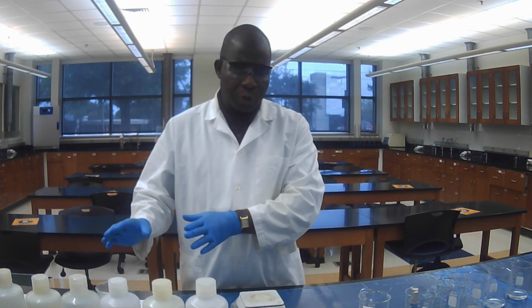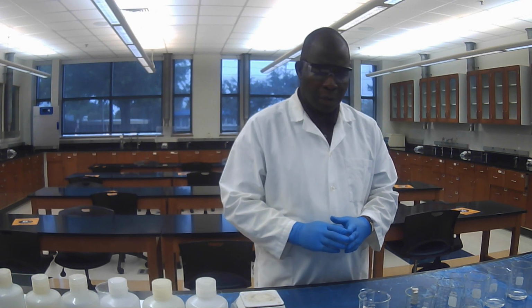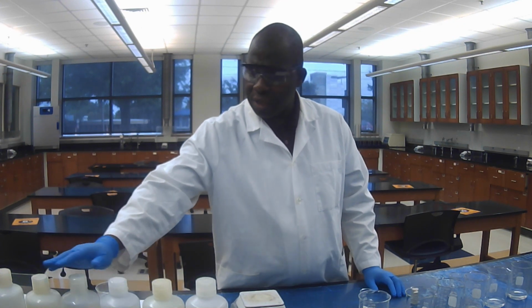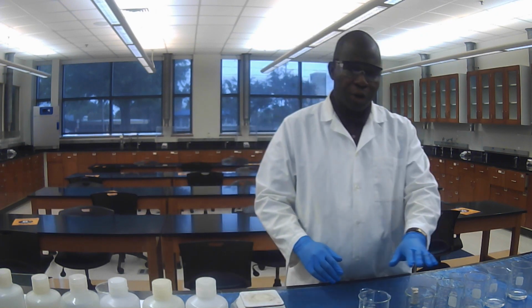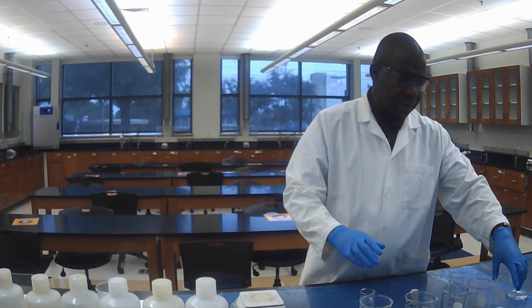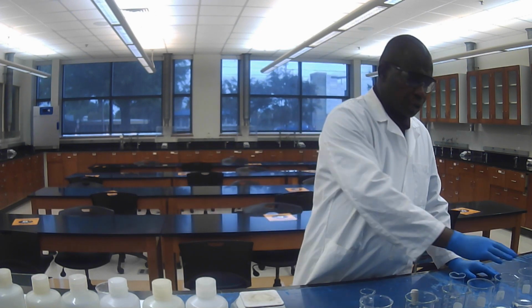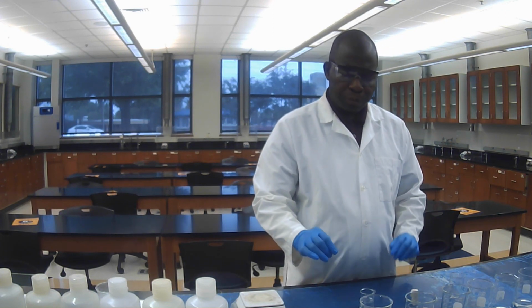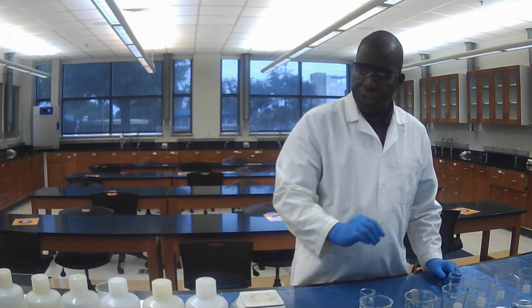While I'm waiting, I'm going to move to the next step in part A, which is adding the 6 salts that have been provided to us for this experiment to each of those 6 beakers. I have already added those salts to each of them. And what I'm going to do is to take the pH of each solution.